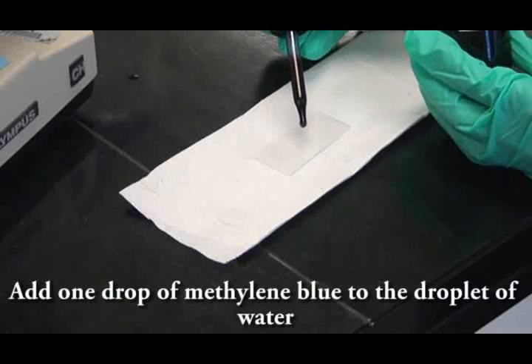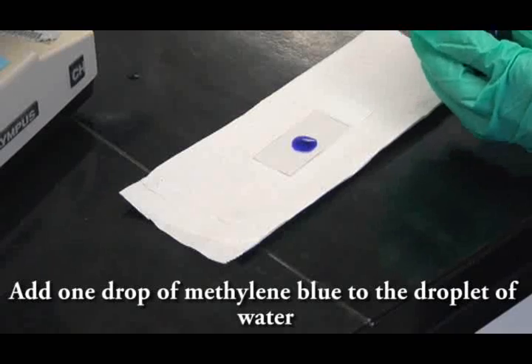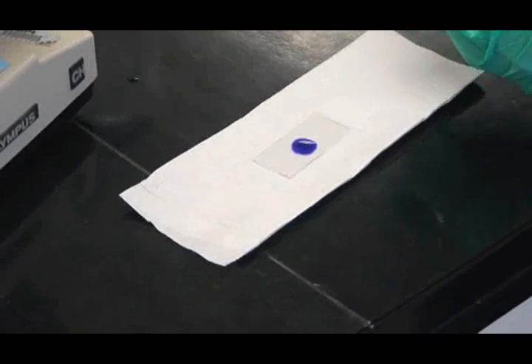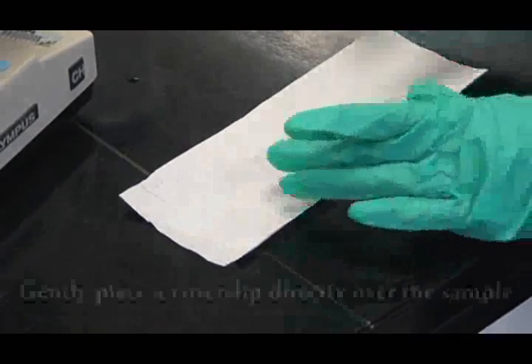Place a small drop of methylene blue on the slide, and then place a cover slip on top of the methylene blue.